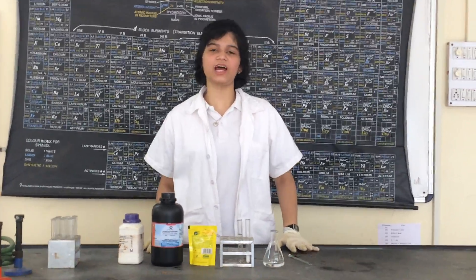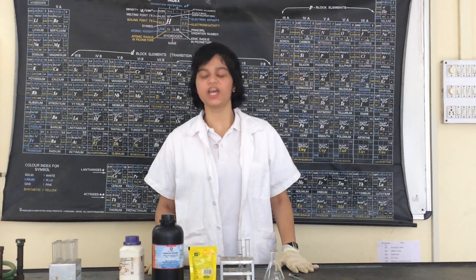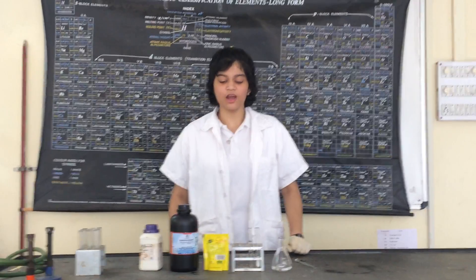Hi, my name is Paral Srivastav and I study in Geetha Maka Junior College and today I will show you how to prepare elephant toothpaste.